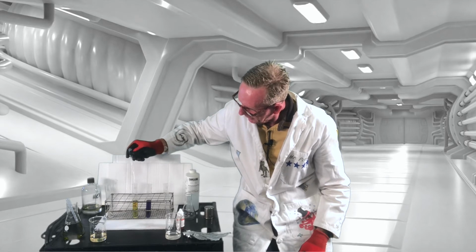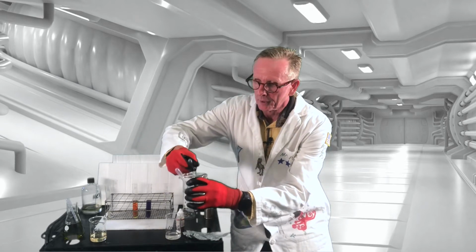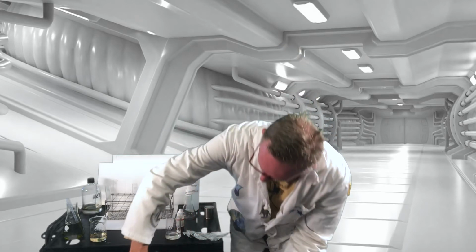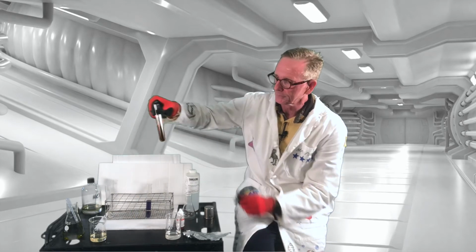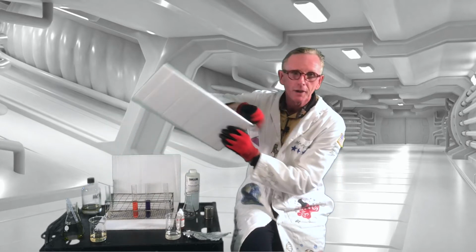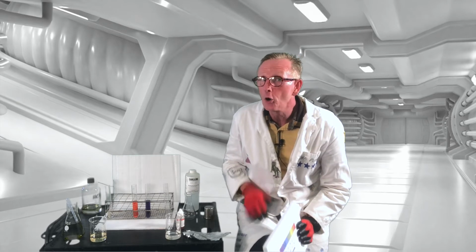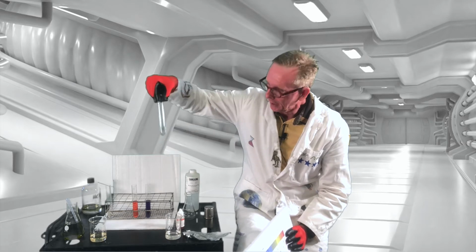1, 2, and 3. Same thing, I just want to rinse this one out real well so it doesn't potentially dissolve it up. Should be done with those pipettes, and yeah, wow, look at that. Really nice, bright pink. So, for you, when you're looking at it, you had your question, you need to come up with your own hypothesis about what would happen. Just so far we've seen what happens.